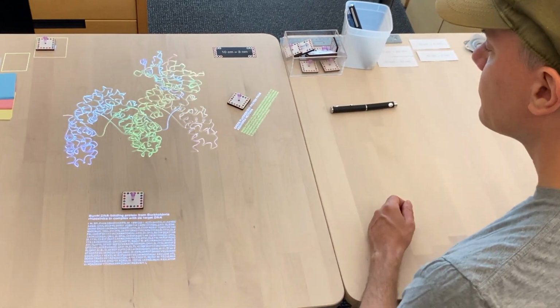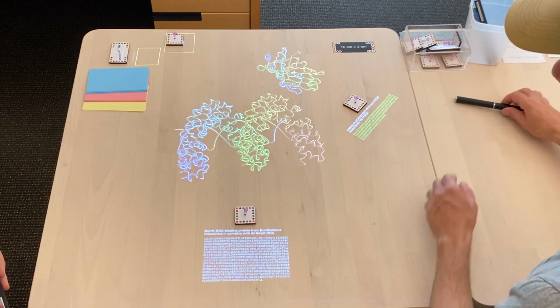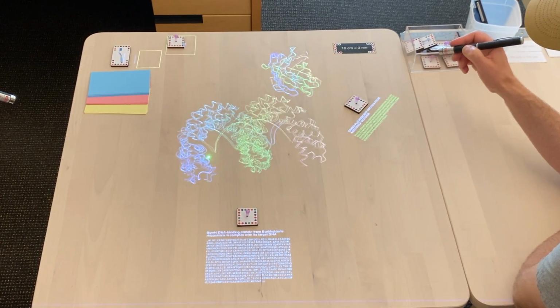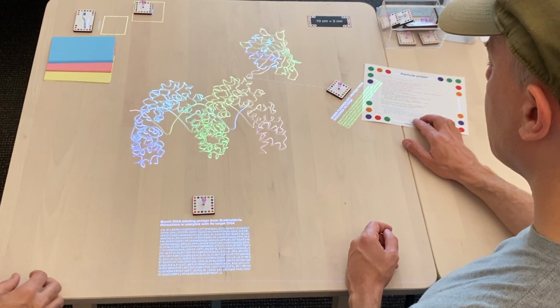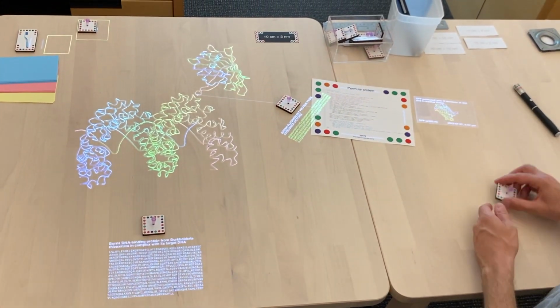And now we're just going to play with them, kind of positioning them relative to each other and thinking about how we want to connect them. In order to connect them, we'll need to permute the GFP by closing up its termini with a linker and breaking the loop somewhere else. So here's a little permute program that we made, and I'm pointing its whisker to where we want the termini to be. And I pick up the permuted GFP using another tube.